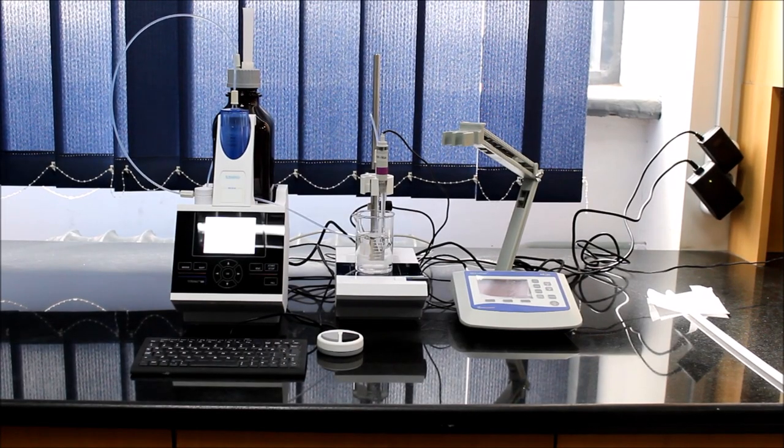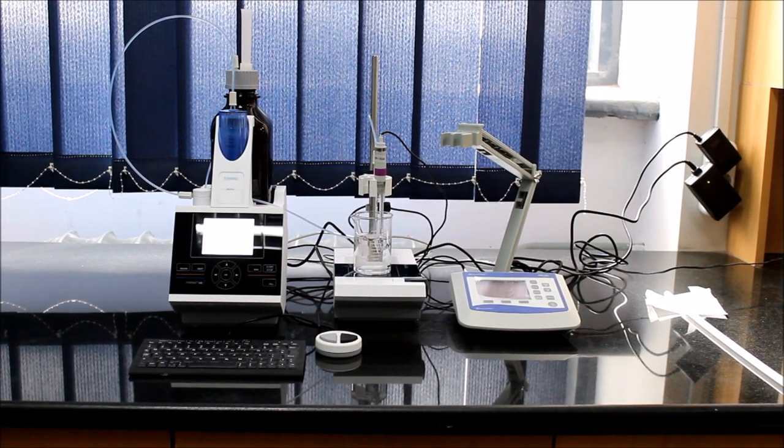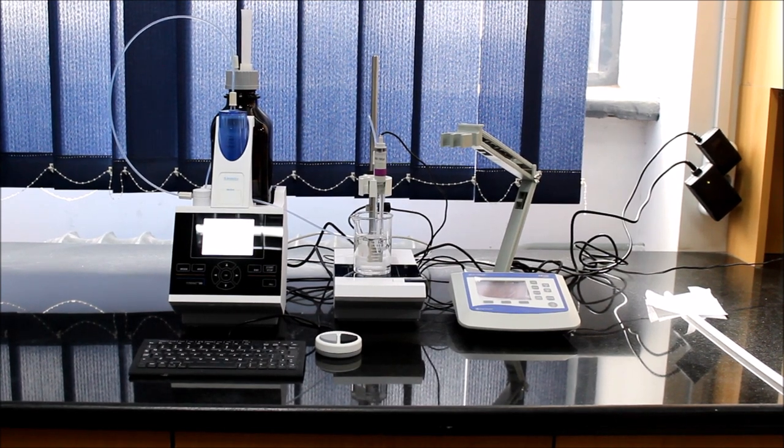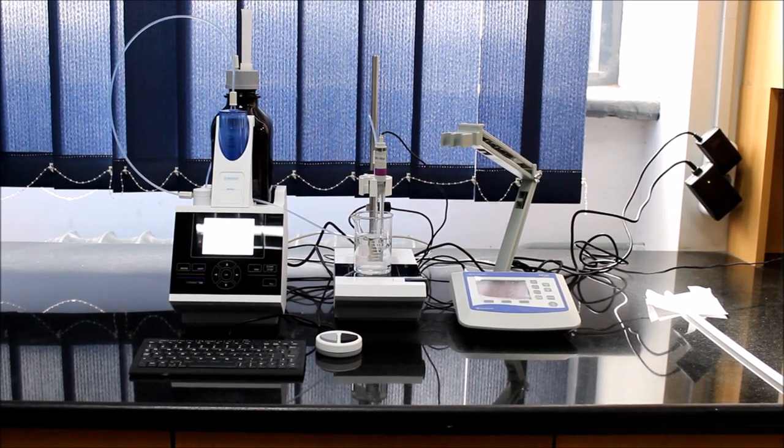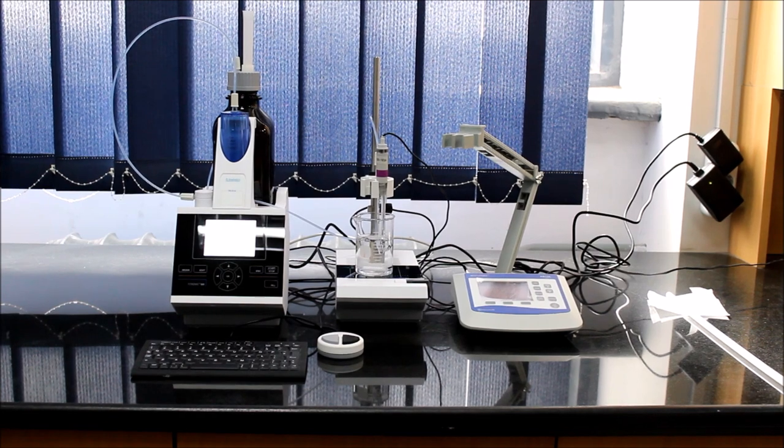These are all the basic steps you need to successfully perform a titration with an autotitrator. If you have any questions or concerns, please write in the comments.